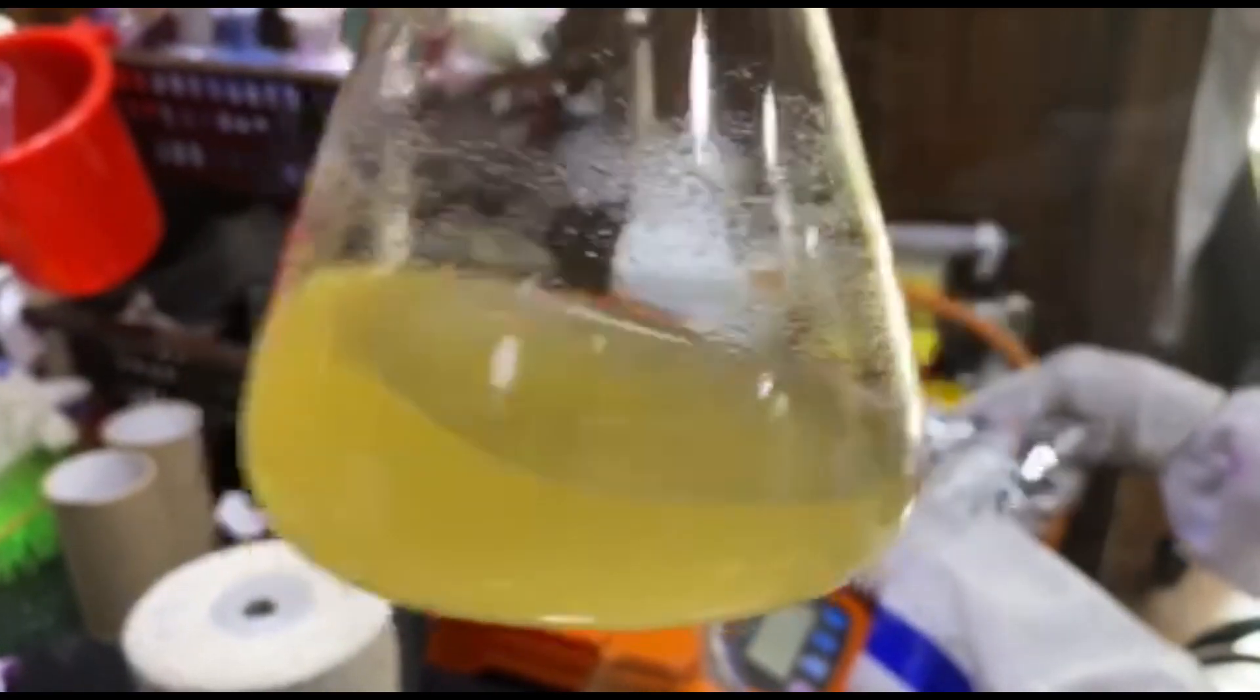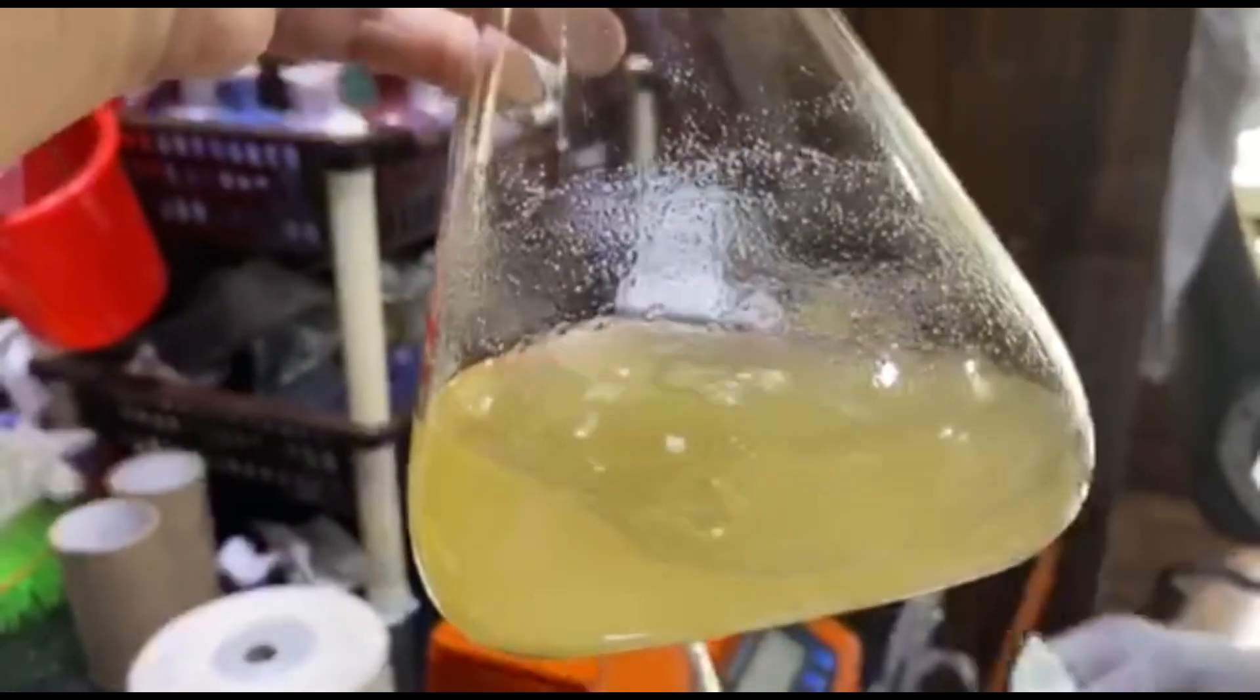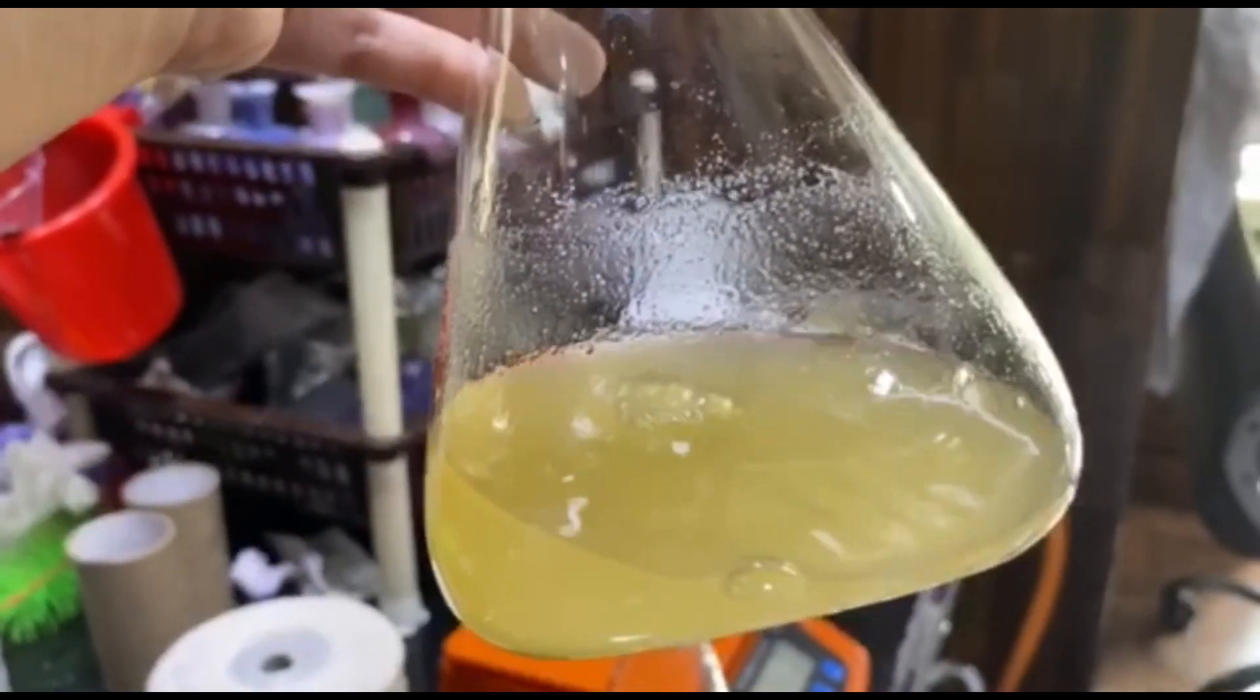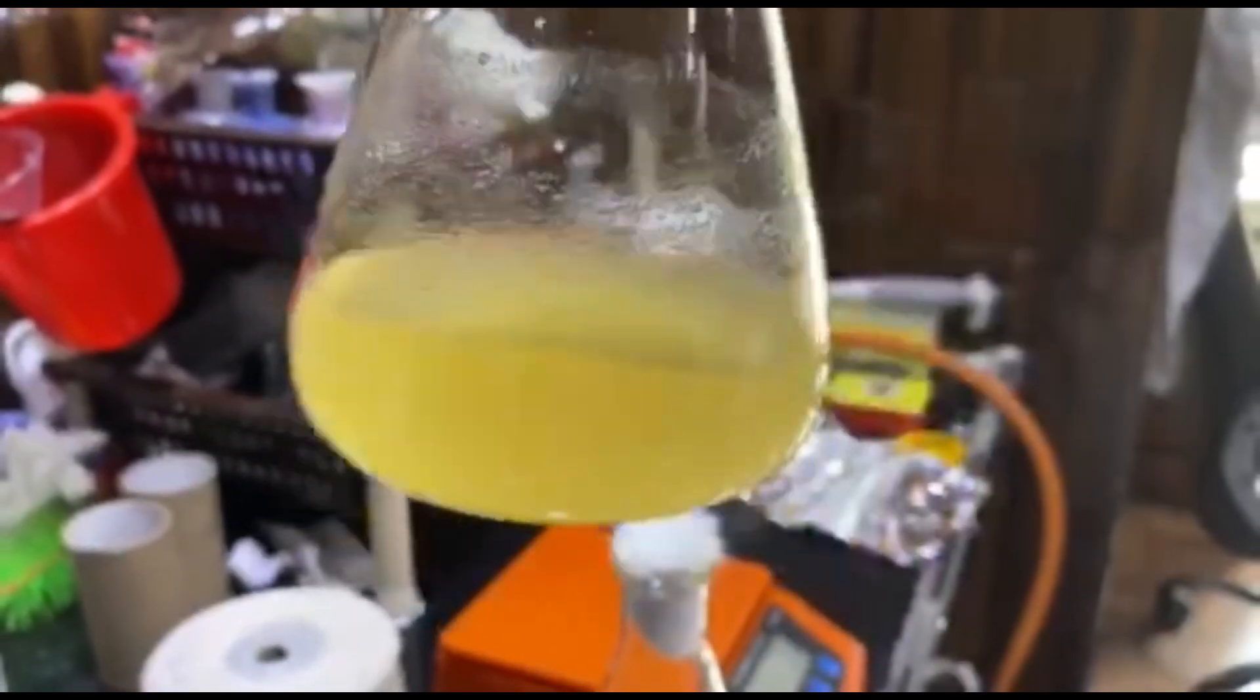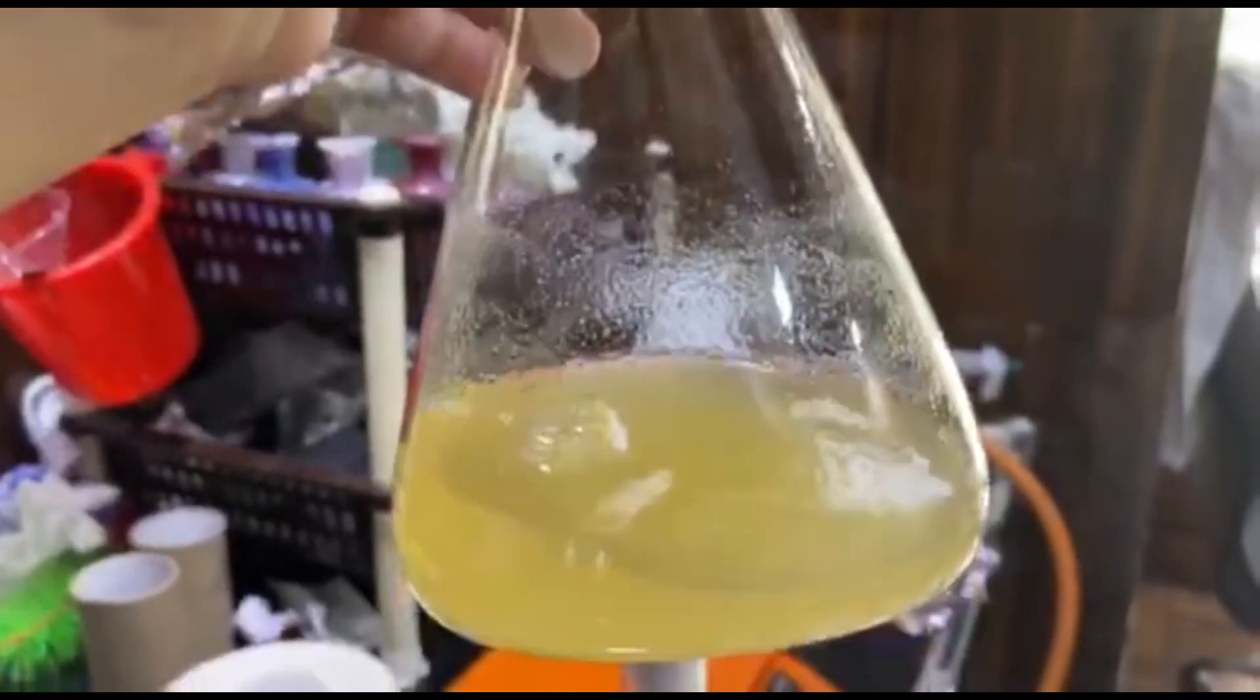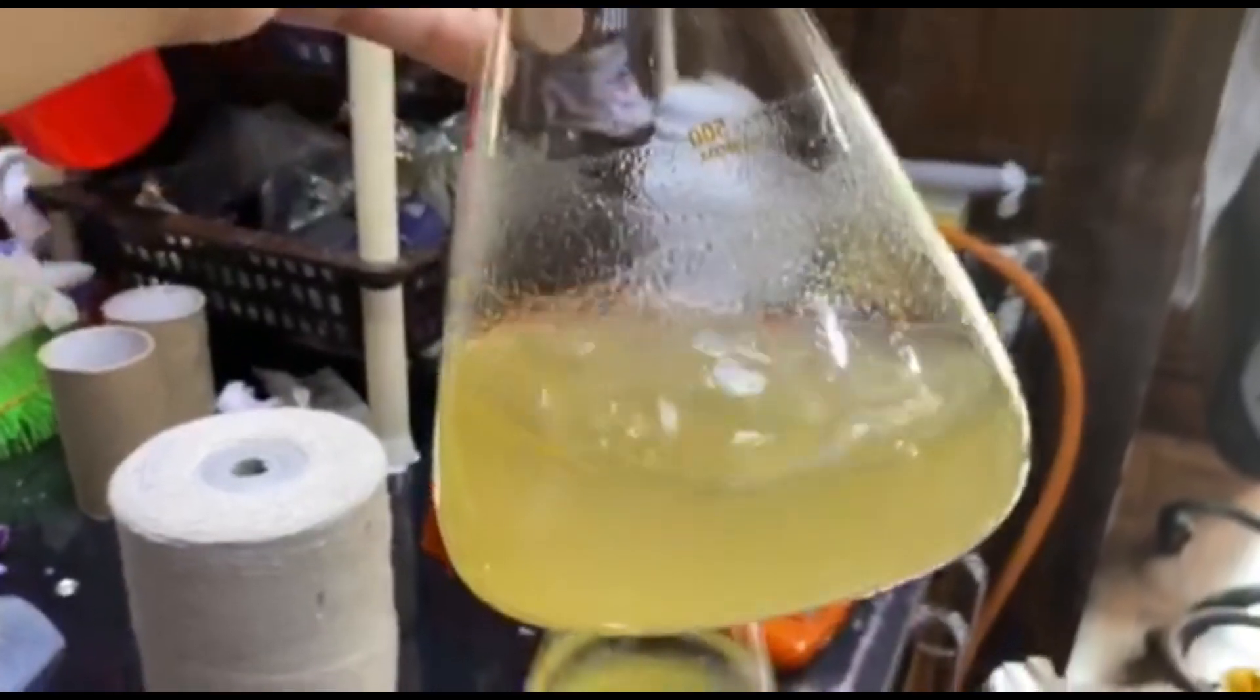Now you can see how the powder clumps are properly mixed in the agar. If you think the clumps are not mixing, then you can heat it for some time so that the clumps are dissolved completely in the distilled water. But here there was no need of heating because the powder is completely mixed, and you should shake it. Shaking is also very important.